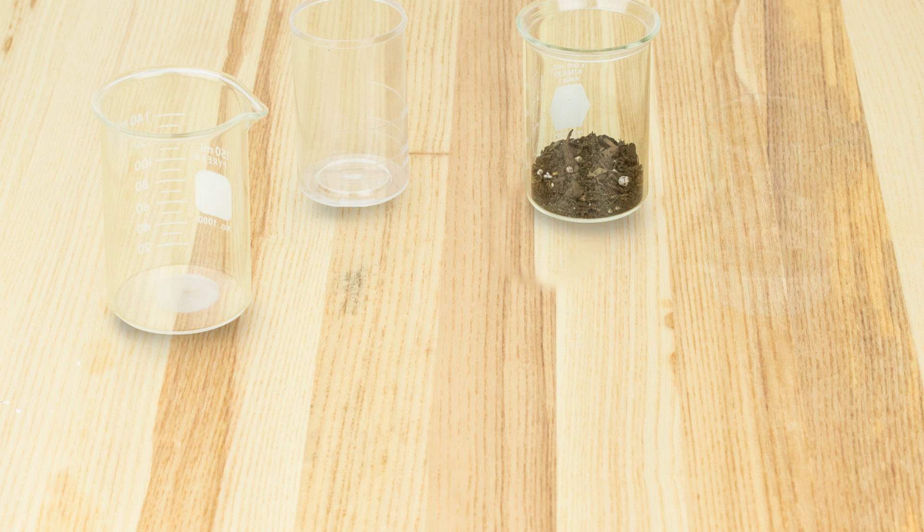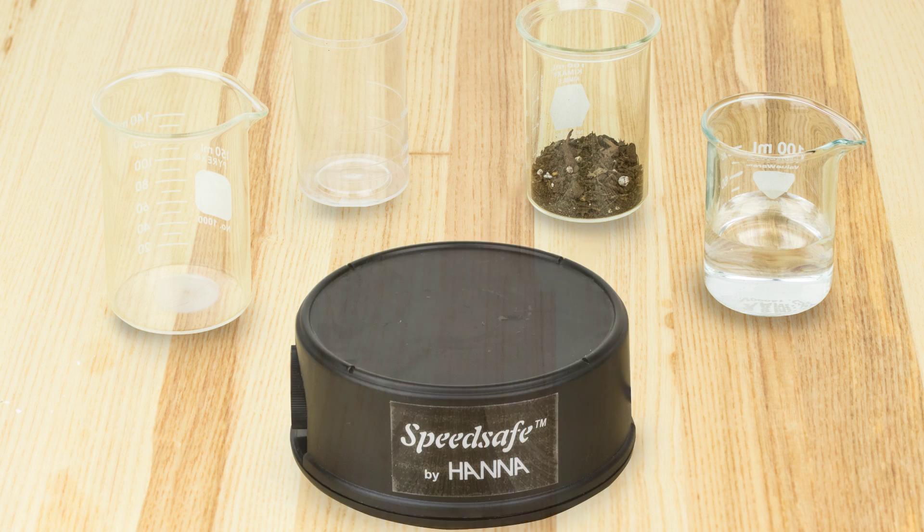For the best results, use a container cleaned with distilled water, a measuring cup, a fresh sample of your soil, distilled water, and a magnetic stirrer or stirring utensil.